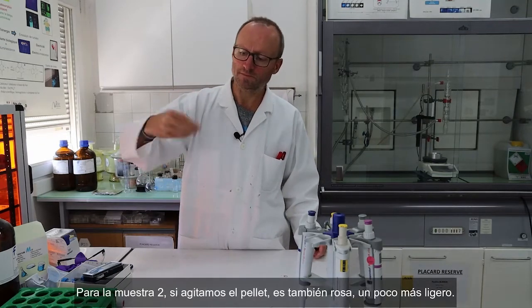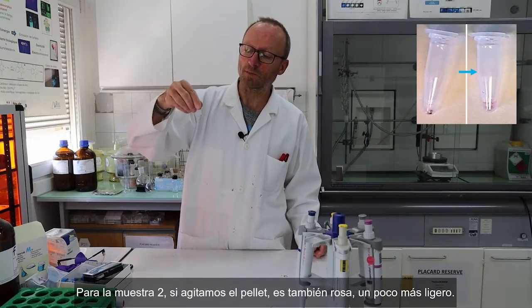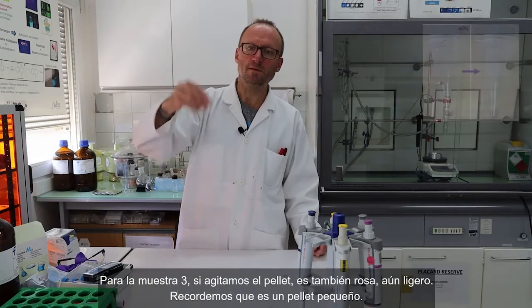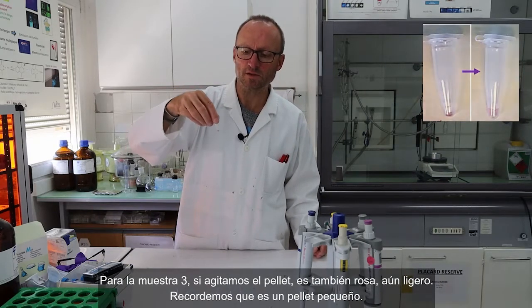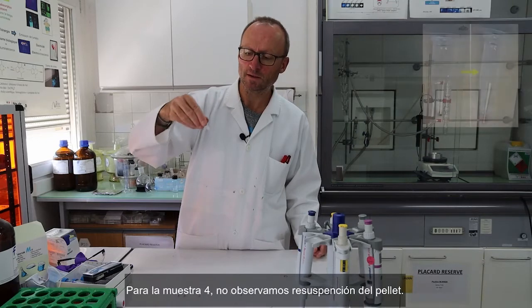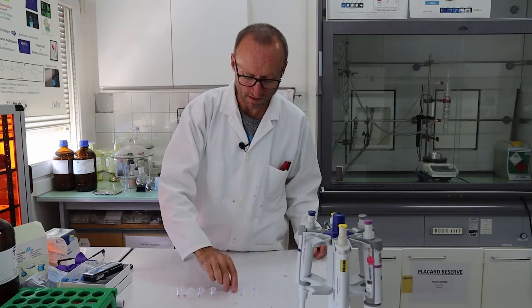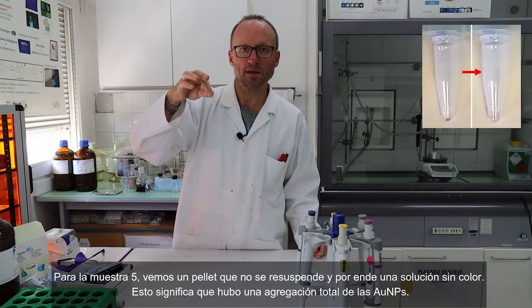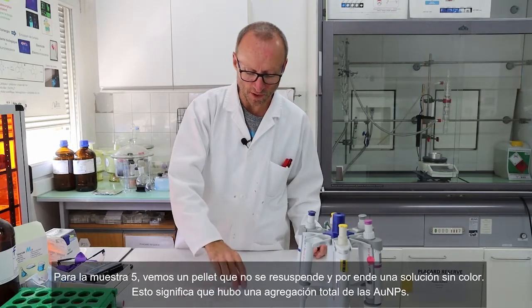For the second sample, it's pink as well, a bit lighter. Okay. For the third one, it's still lighter. Okay, so remain a small pellet. For the fourth one, there's no resuspension. Okay. Or almost no. For 5, there is a pellet, okay? You get a colorless solution, meaning that there is a full aggregation of the nanoparticles.